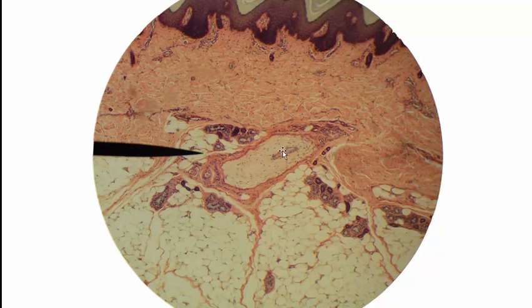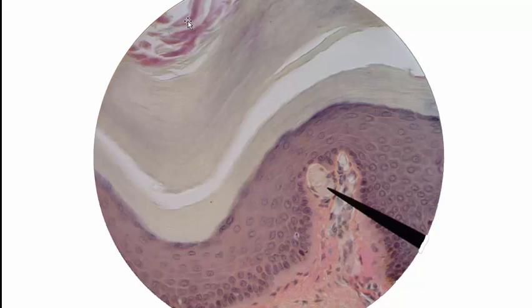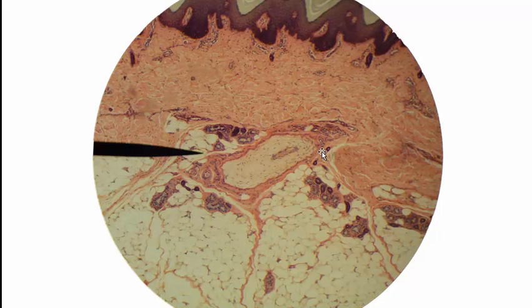And the way to recognize these is they are much larger than those Meissner's corpuscles we were looking at a moment ago. In fact, remember, this is a lower magnification. This is 100 times magnification. And those Meissner's corpuscles were up here, and we were at 450 times magnification, which made this little dermal papillae maybe look this big. So much higher magnification. These Pacinian corpuscles or lamellar corpuscles are much larger. And again, they're sensing pressure or deep pressure.